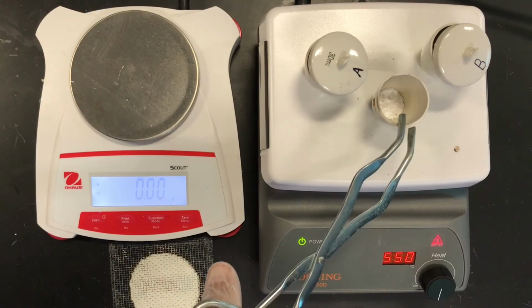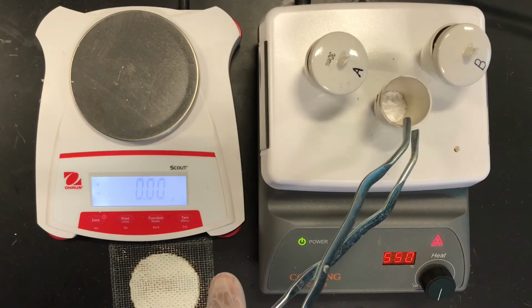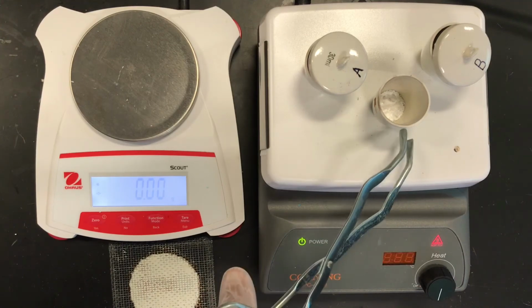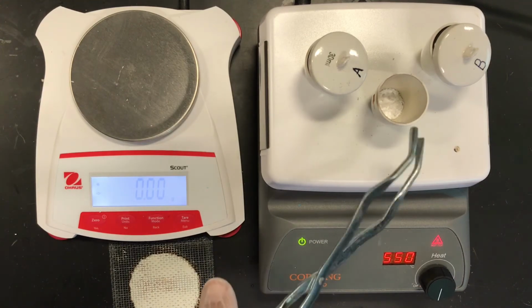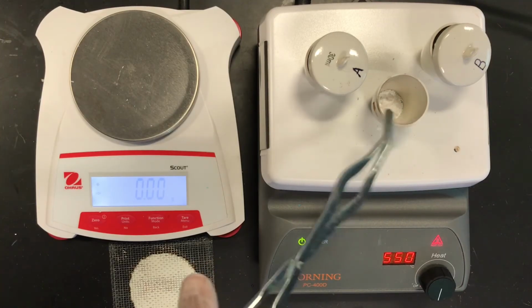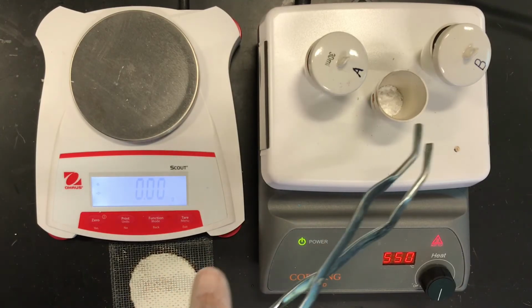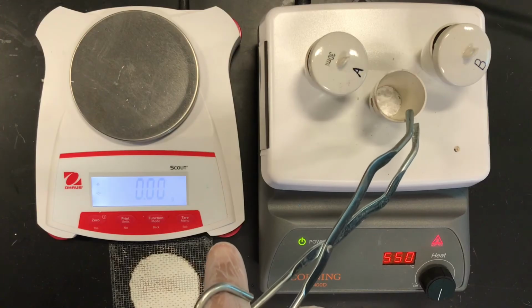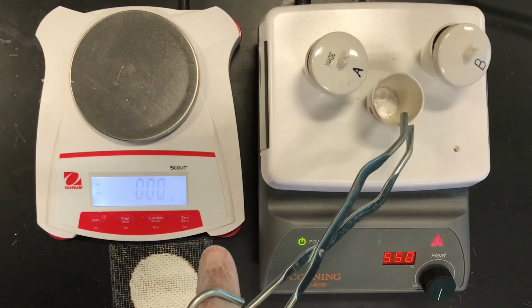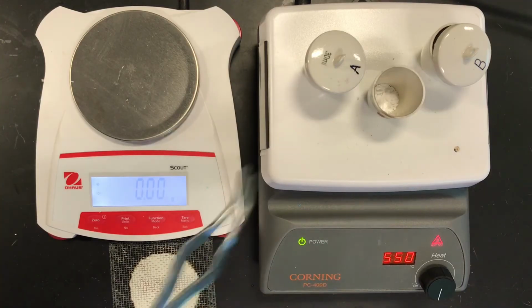Notice my reference crucible here didn't change color. If you were with me with the copper sulfate pentahydrate lab, it did change color. And of course, the reasoning there is that this is magnesium, not copper. Copper is a transitional element, and you have some crystal field splitting that gives the color with transitional elements with water. Here, because magnesium is not a transitional element, there are no d orbitals that have electrons in them, or no d orbitals at all. But the point is there's no color change associated with it, although it should look drier.